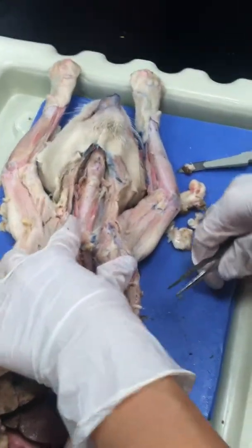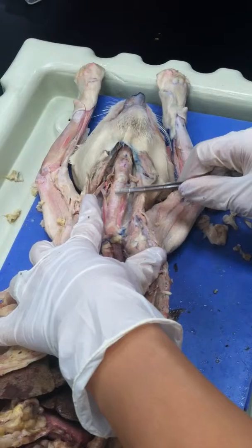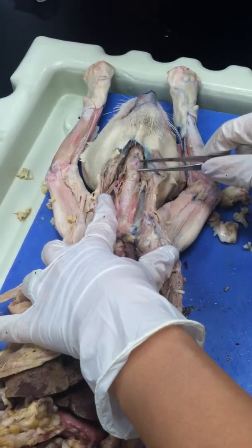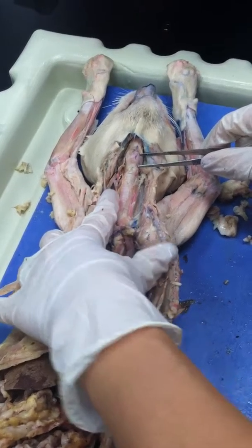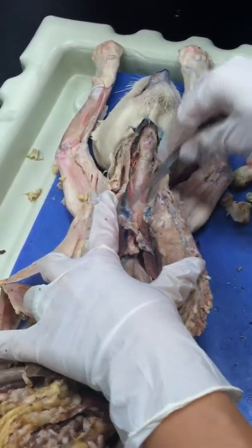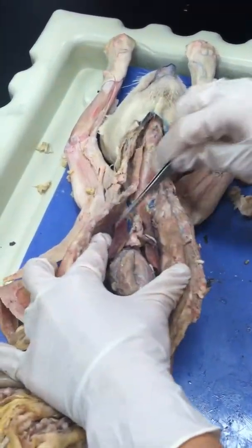Go ahead. You're on. Okay. You start with the trachea, high up like this. The thyroid cartilage is on top of it, this one. And then the trachea divides into two bronchi, one on each side for each lung, like that. The two lungs have many lobes.